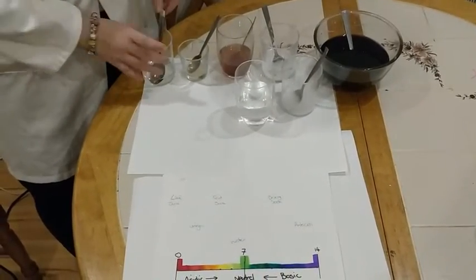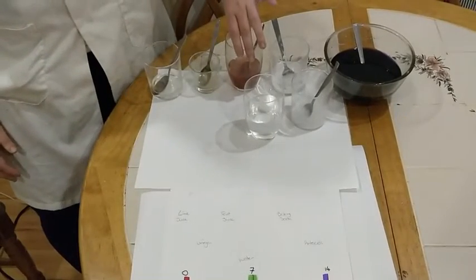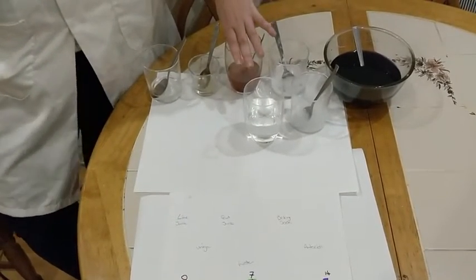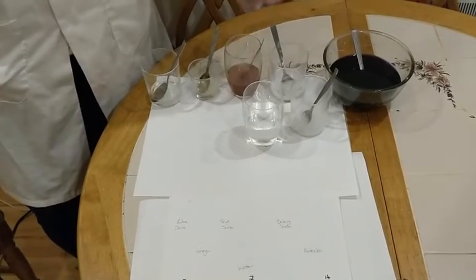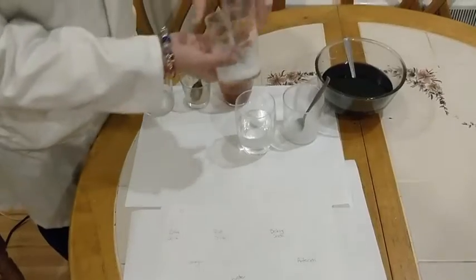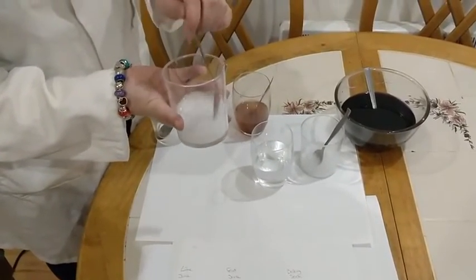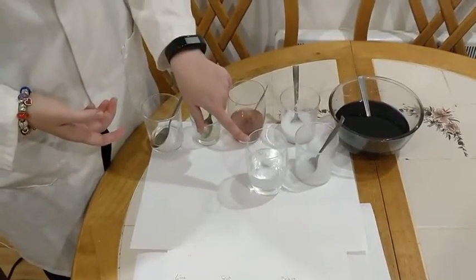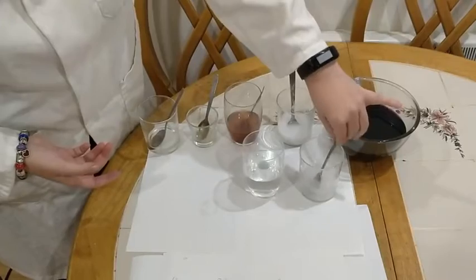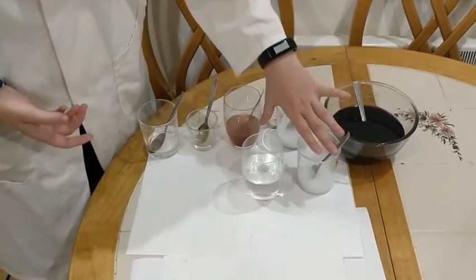The first thing, we have vinegar, we have lime juice. This is a mixture of fruit juice, because as you know, fruit juice is very acidic, which is why we need to brush our teeth before bed, so the fruit juice is neutralised. We have a mixture of bicarb or bread soda and water, but it needs to be kept stirred because it will separate. We have water to show what is neutral, and we have an antacid, because we have antacids to neutralise the excess acid in our stomach.